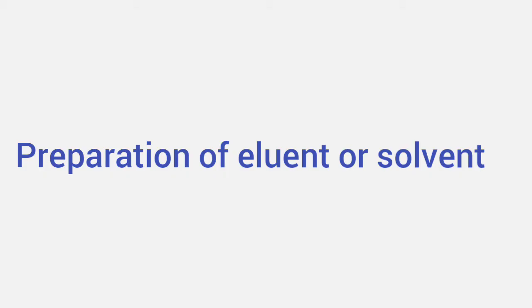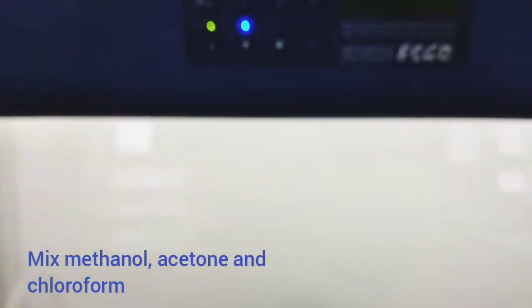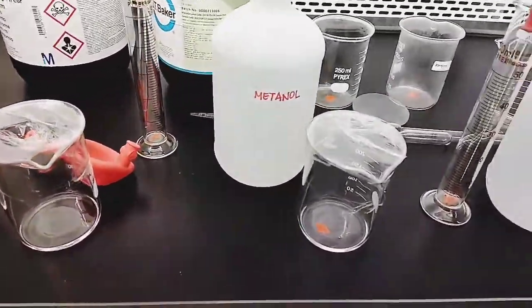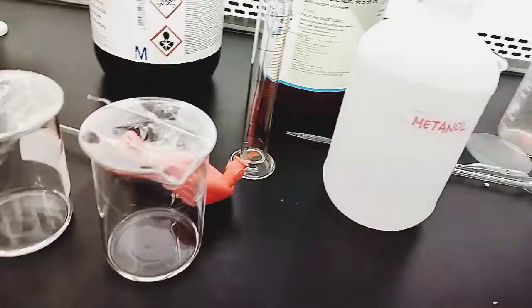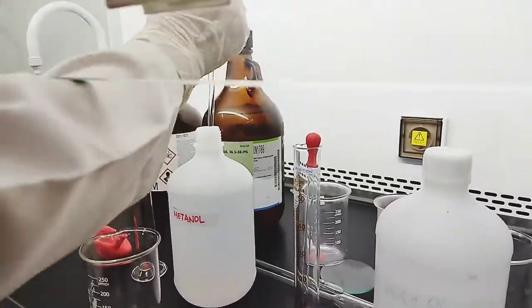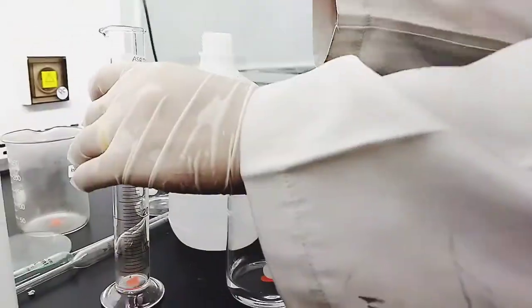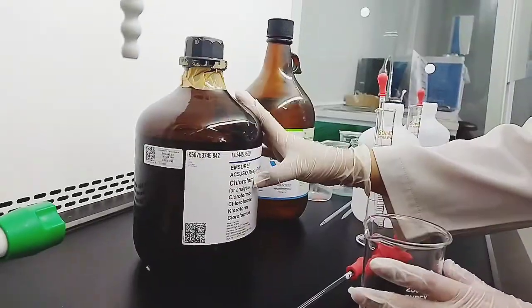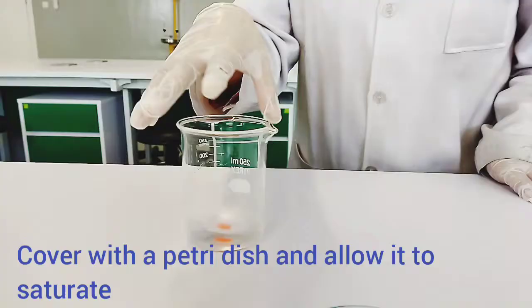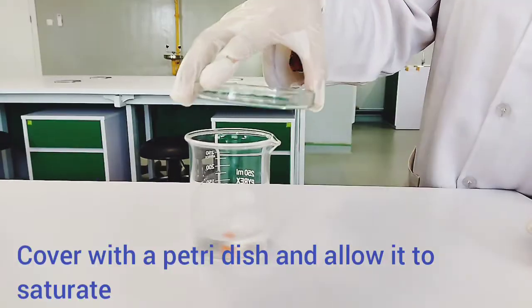Preparation of eluent or solvent. Mix methanol, acetone, and chloroform in the beaker glass. Cover with a petri dish and allow it to saturate.